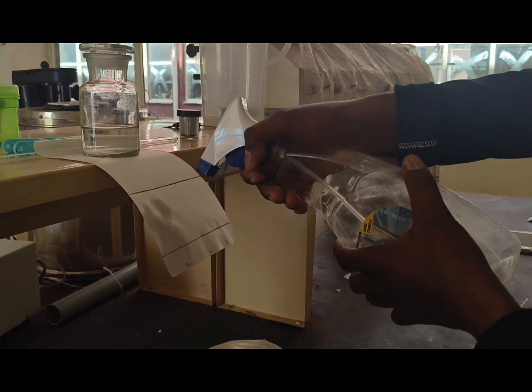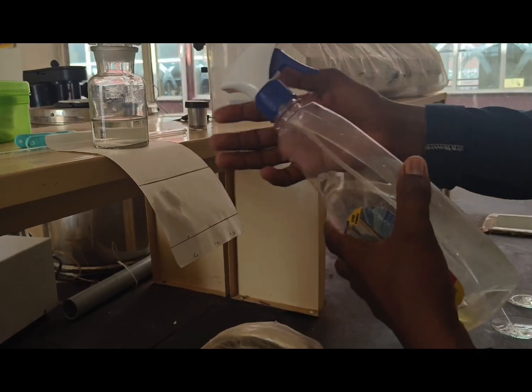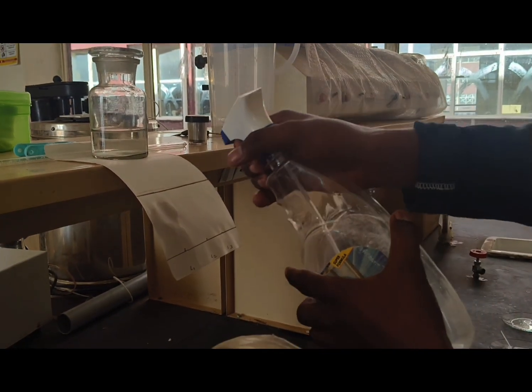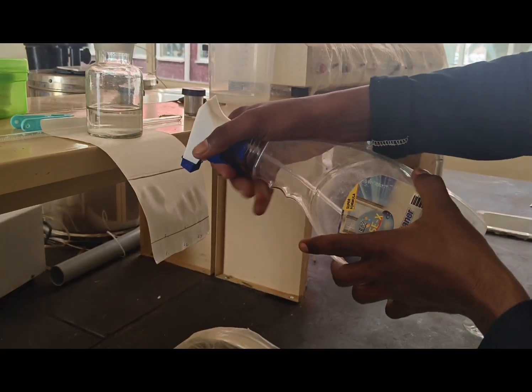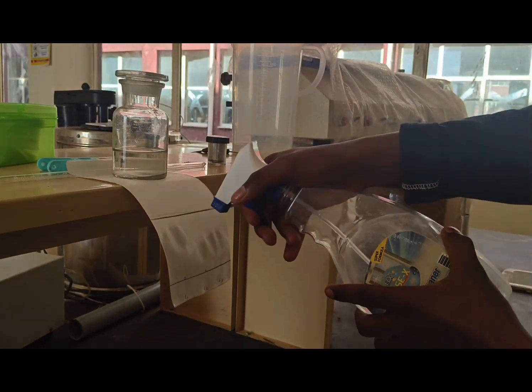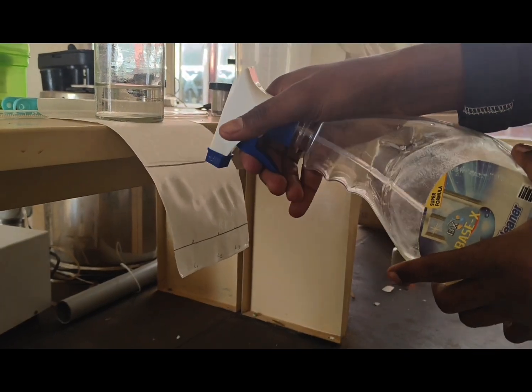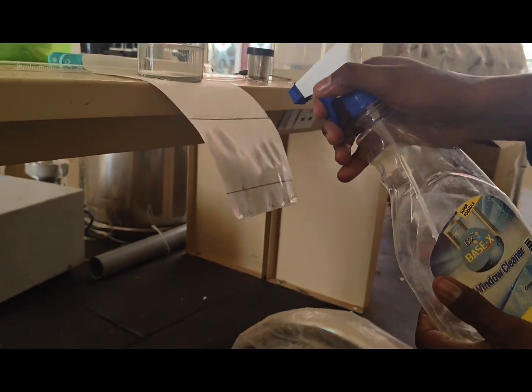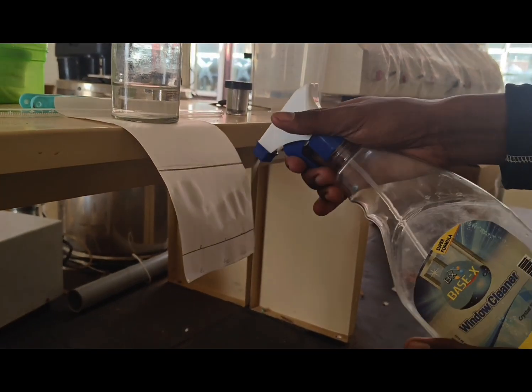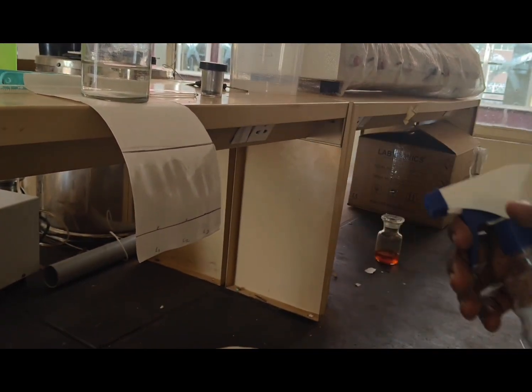So after drying, that means after completion of the experiment, we can spray the ninhydrin. This is the bottle they used for spraying the ninhydrin on the dried paper. That is paper chromatography. The experiment is over and it is dried. After drying, we can spray uniformly so that again after spraying it will be dried, so that we will get the purple colored spots developed and it will be visible clearly.